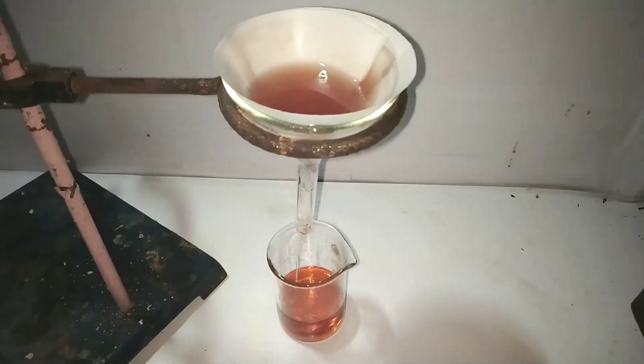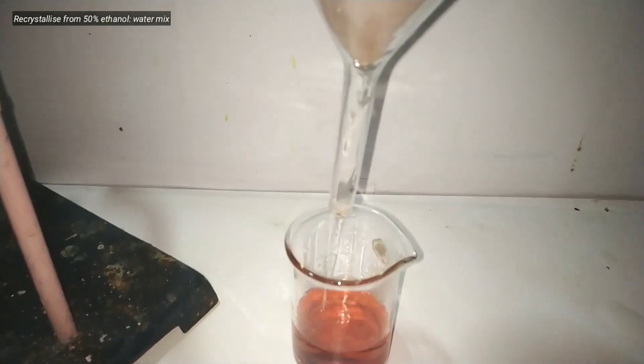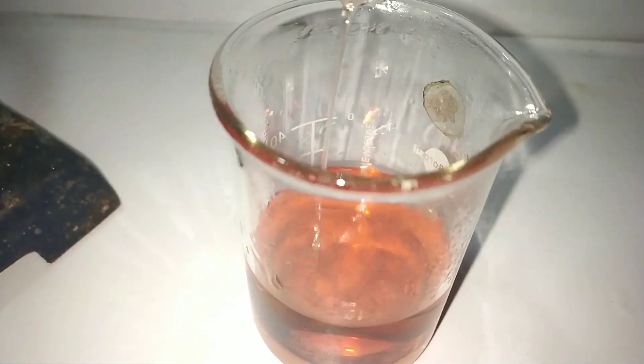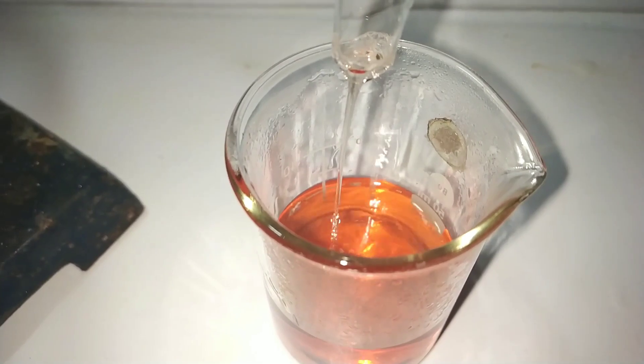Then I decided to recrystallize it. For that I dissolved the compound in 50% alcohol in water solution and heated the solution. The solution turned pretty dark but clear solution was obtained.